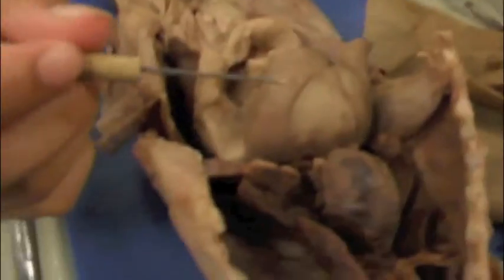The chest cavity. Alright, so here we have the heart of the cat, which looks like this huge prune here. And next we have the lungs. We have 7 little lobes of lungs. Here's 1, 2, 3, 4, 5, 6, and 7. And finally we have our aorta, which is coming out of the heart right here. As you can see, this vein right here.